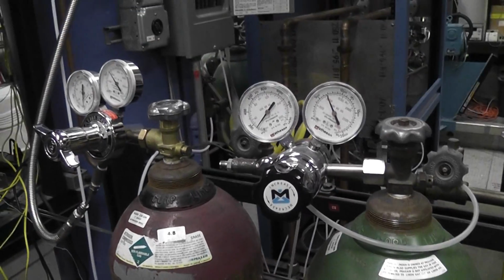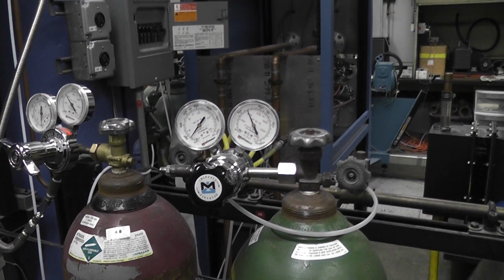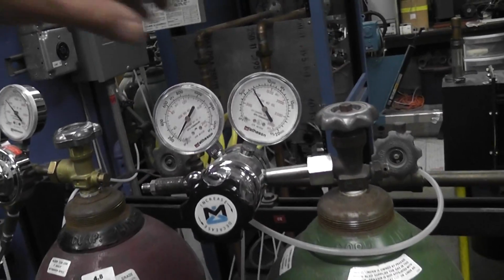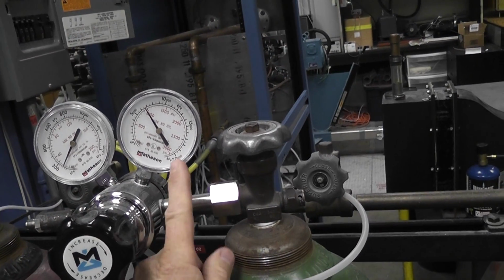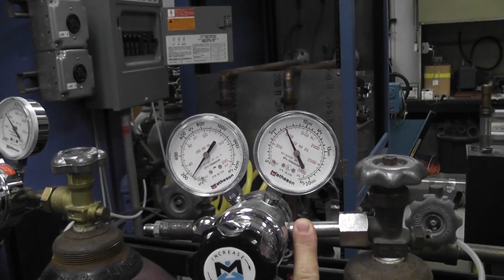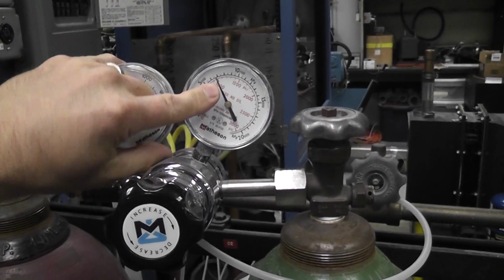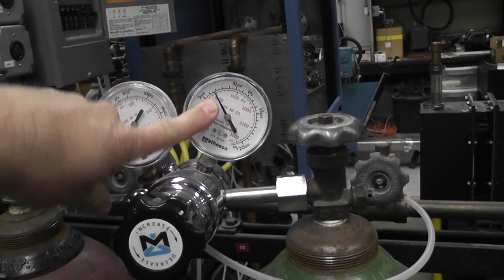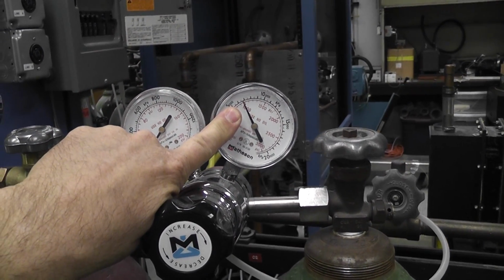All right, let's look at a couple other things while we're talking about gases. So here's a pretty standard cylinder, okay, and what you see here is the top of the cylinder, and this is the main valve that controls the flow from the cylinder to this side of the regulator. And what we see right now is that there's about 1,000 psi in this tank. This is a tank of oxygen, okay? So when we open that up, this gauge reads 1,000 psi. That's too high for most of your normal laboratory applications.